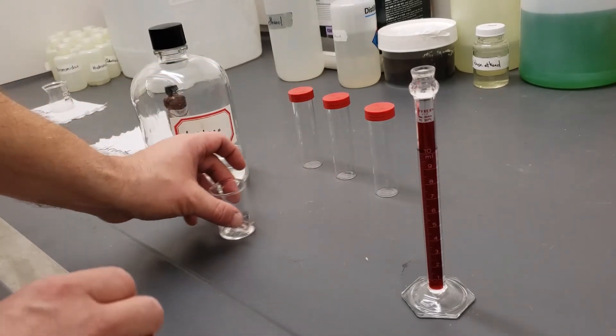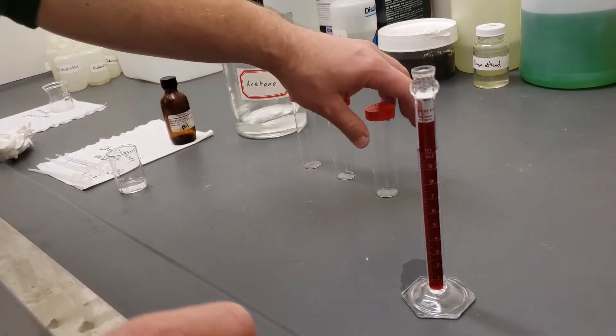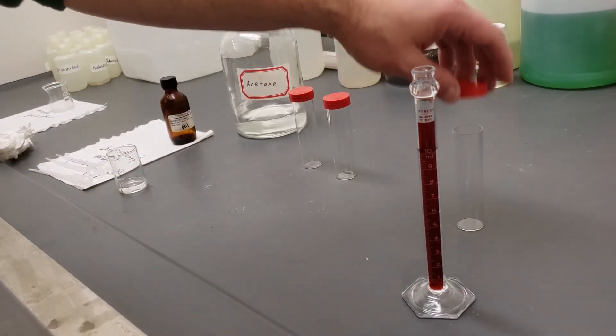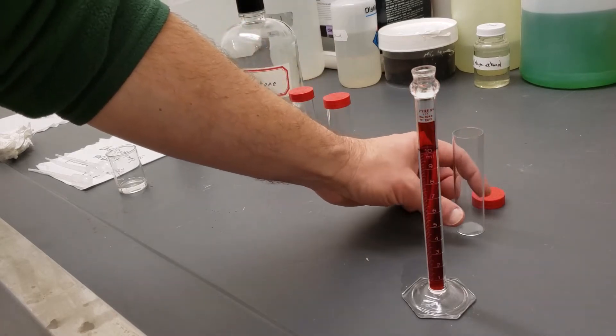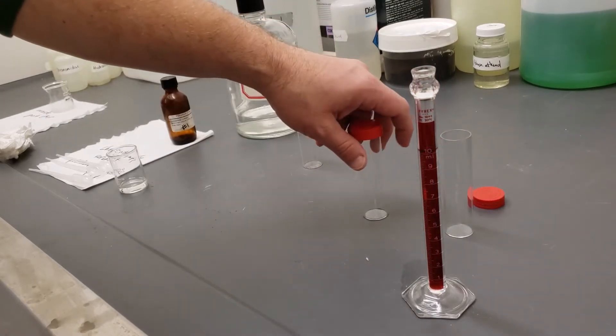My extra acetone, I'm just going to slide off to the side there. And here are my chromatography chambers.